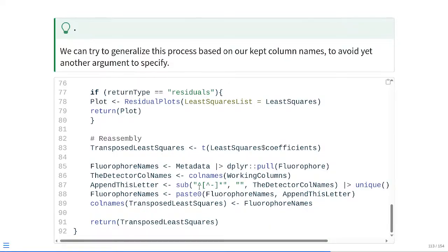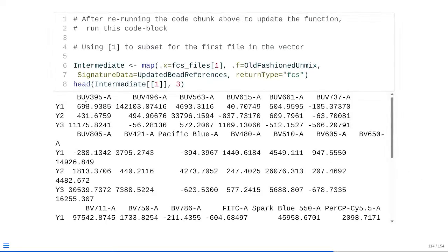Using the sub function, we're basically getting rid of anything in the first part of the individual names for the detector columns before the little hyphen mark. That way we're keeping just the last ending of it, which will be -A, -width, -height, whatever the case may be. And we're just keeping the unique value, which will be the letter we want to append on. At that point, we can just take our vector of fluorophore names, paste on with paste0 the actual appended letter, so -A or whatever it may be. At that point, we have the corrected fluorophore names, which we can then use to replace the existing column names in the transposed least squares. At that point, refresh our function, rerun, and as you can see, we've updated the column names accordingly based on what we're expecting to see.